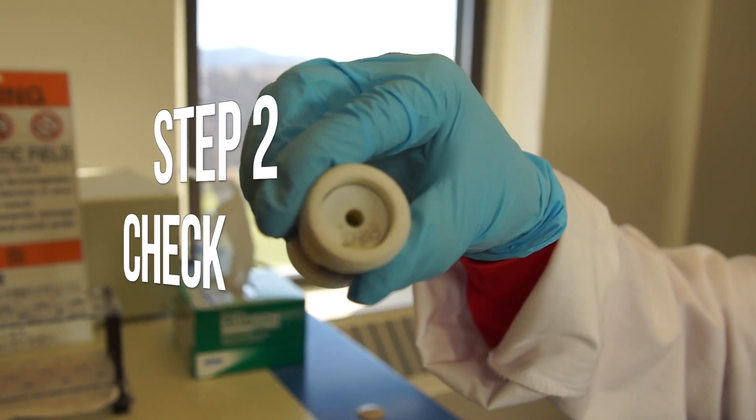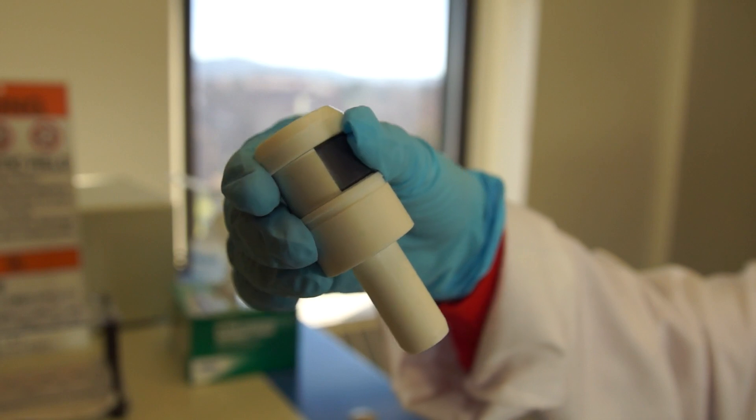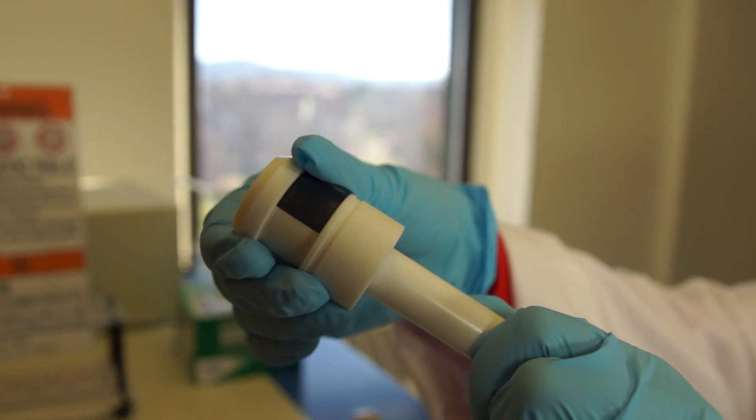Now, check to make sure that the NMR spinner turbine is pulled out all the way. If not, make sure it's fully extended.